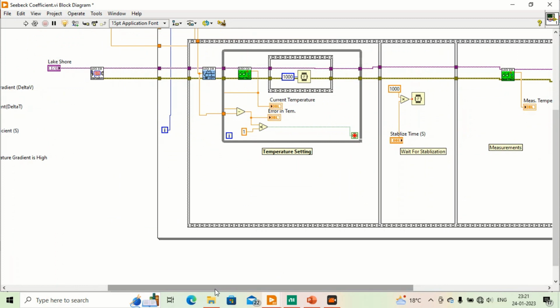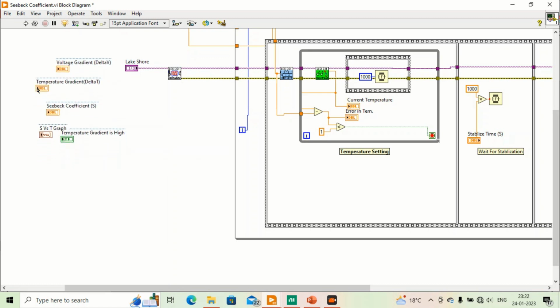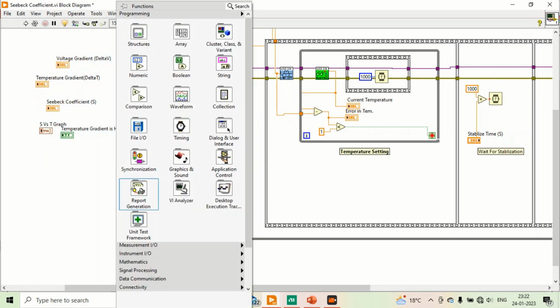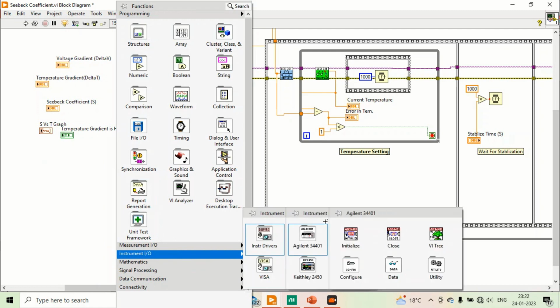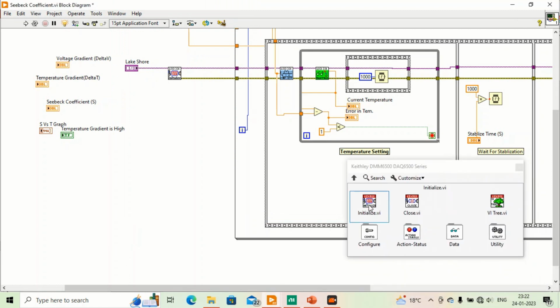Okay, now in order to measure temperature gradient and voltage gradient, I will use Keithley DMM 6500 digital multimeter. It is good to use its instrument driver to make the measurements. So I will go in instrument drivers, this one. Okay, so first I will initialize it. Multimeter I'm using, I have also a 10 channel scanner card.